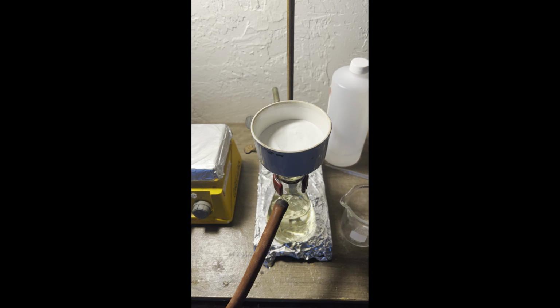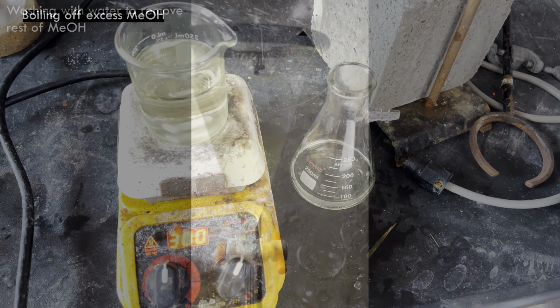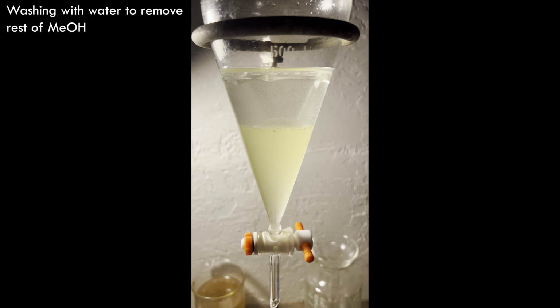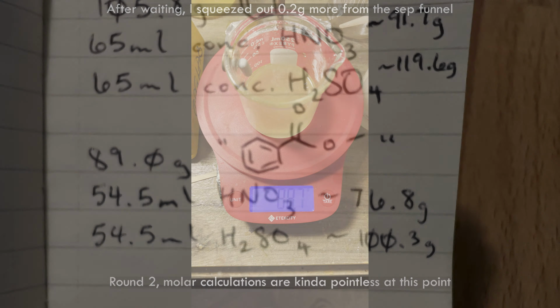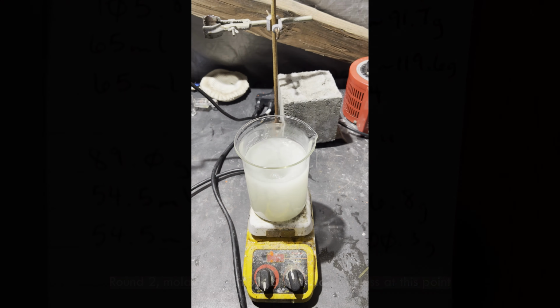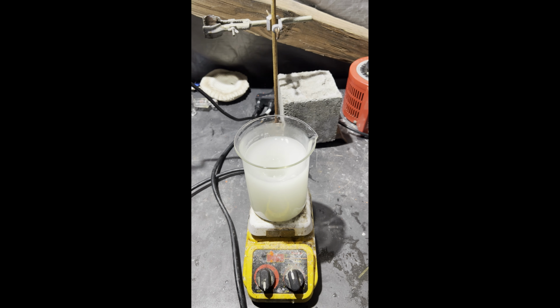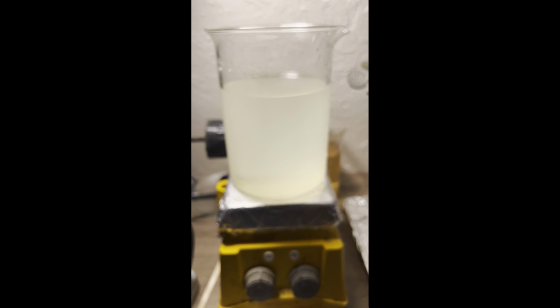The third sign was when no solid precipitated, and I was able to use a separatory funnel to separate the 2 layers. Essentially, the acid dissolved in the unreacted methyl benzoate. Adding ice-cold methanol did cause a solid to precipitate, which I filtered off, but there wasn't nearly as much as there should have been. I boiled down the methanolic filtrate and redid the reaction, scaled down to the amount of unreacted ester. Same thing happened, and I got even less product.